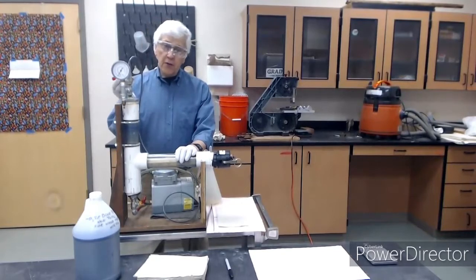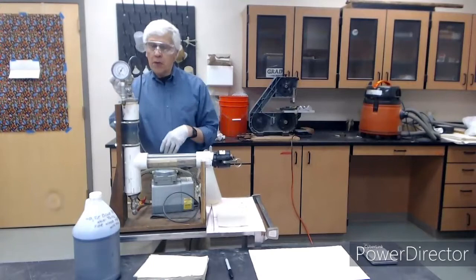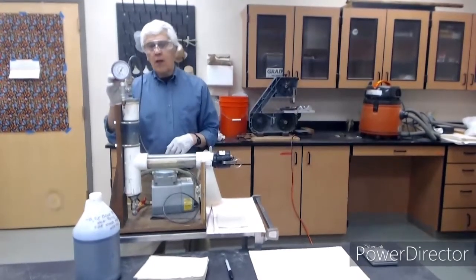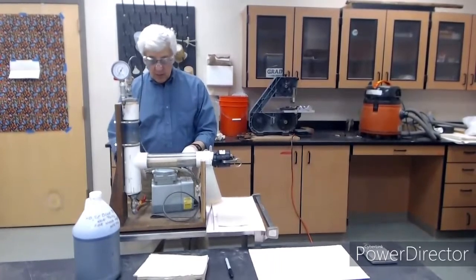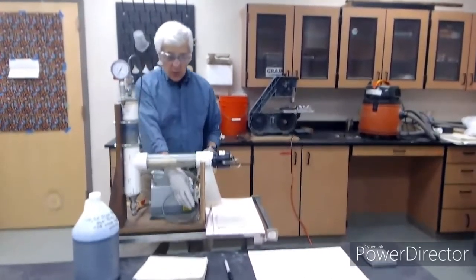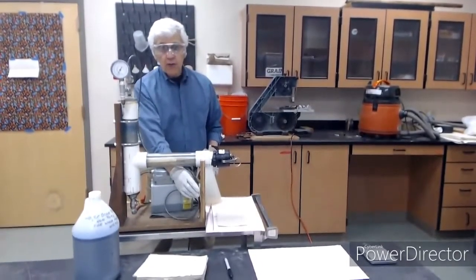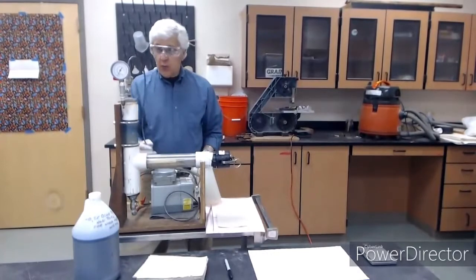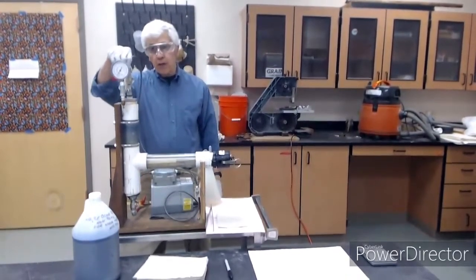To get the vacuum, first of all, we put this on V, and we open this valve here, and then the vacuum will see, you can see that, maybe you can't, hopefully you can see that this pump has two leads to it. There's two tubes that go into the switching valve here. So we have one tube that comes out. So both the vacuum and the pressure are going to enter the cylinder here.